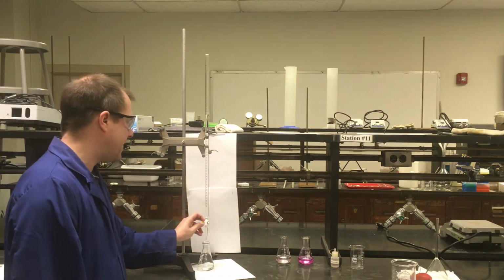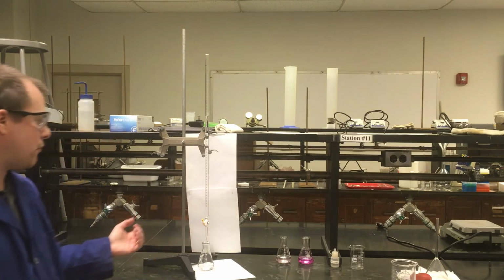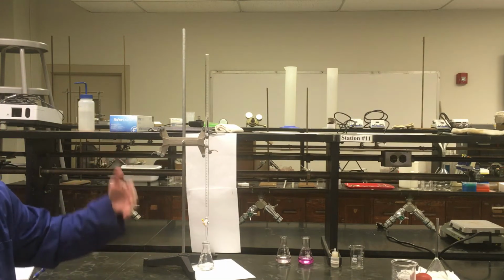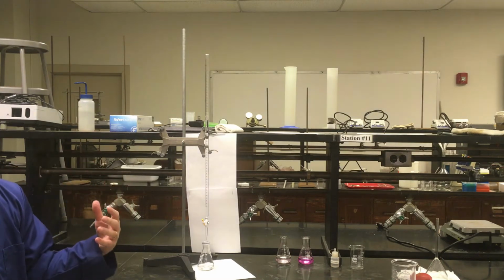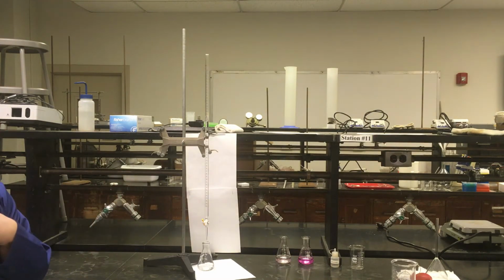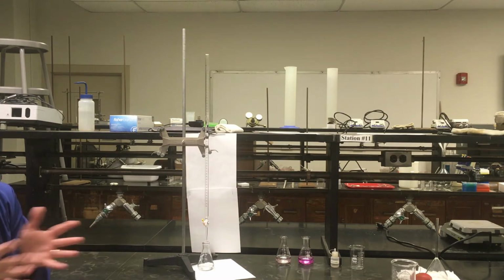So instead of doing the entire reaction adding drop-wise like this, at a general pace, just drip, drip, drip, adding 25 milliliters that way is going to take a really long time. Having that knowledge, since I've done a couple of trials, I can now speed this up some. But again, if it's your first trial, you couldn't really do this; you want to go slow.